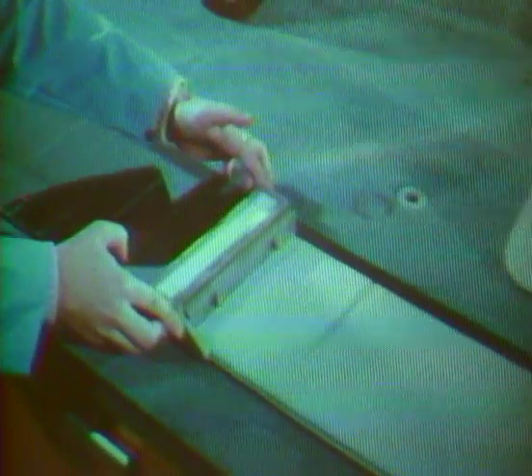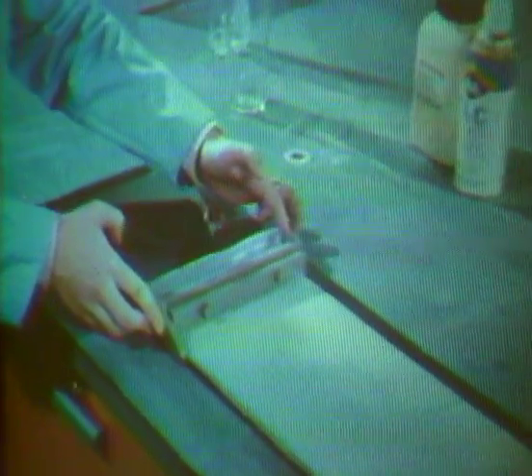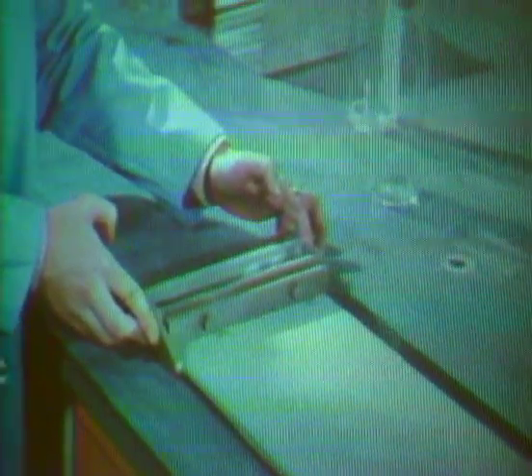TLC plates can be prepared in the laboratory or purchased commercially. They are of many sizes. Even microscope slides can be used as TLC plates. The coating is an adsorbent such as finely divided silica gel, alumina, or cellulose. The thickness of the layer varies between 1/10 and a few millimeters. The plates are usually activated by heating for several hours at about 110 degrees centigrade, then stored in desiccators.